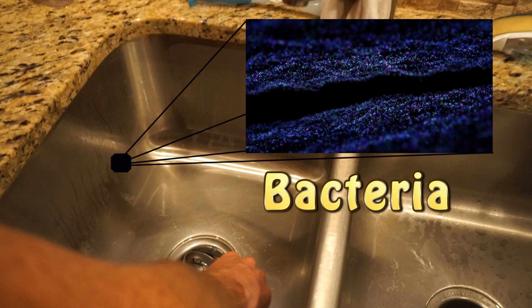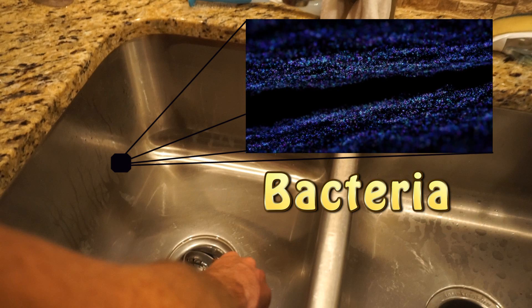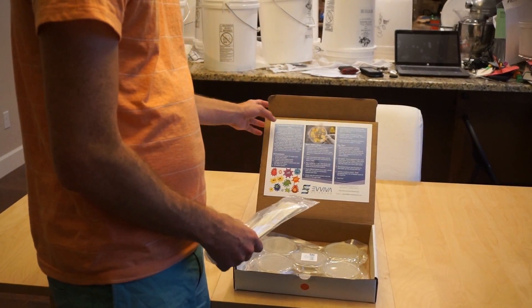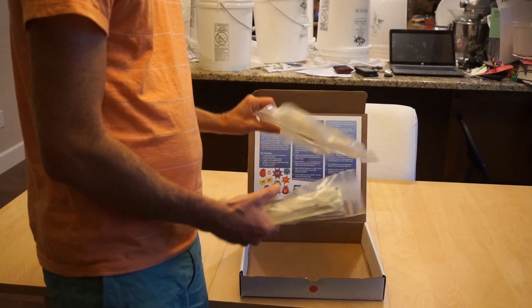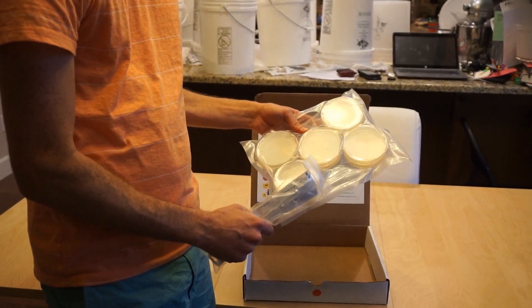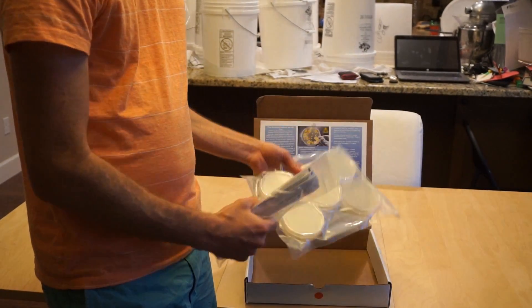Even though bacteria are everywhere, today I want to show you some parts of your house that have more or less bacteria. I'm going to do this through an experiment, testing how dirty common household items are. I'm going to use a tryptic soy agar kit to sample household items and spread the bacteria or fungus on here. We're going to see how many colonies form. Since bacteria and fungus are so small, you can't go around counting how many are on each object. So you spread it on these agar plates, let it grow, and count how many colony forming units there are. If there are more colony units, that means there was more bacteria to begin with.